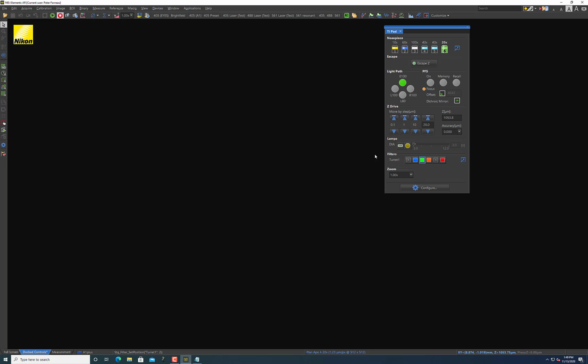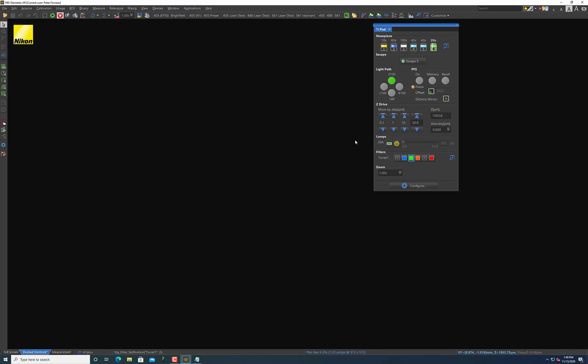What if you are not interested in looking at fluorescence and instead you're interested in looking at the Brightfield illumination? As I mentioned before, there's a little bit of idiosyncrasies when using the A1R's Brightfield illumination. Most basic setup is you'll want to turn your filter cube so that there's nothing there to filter light.